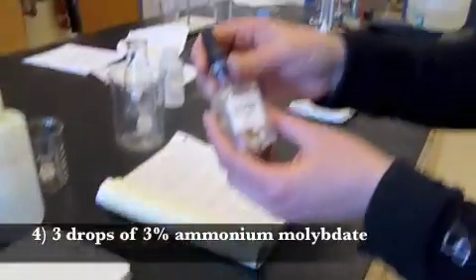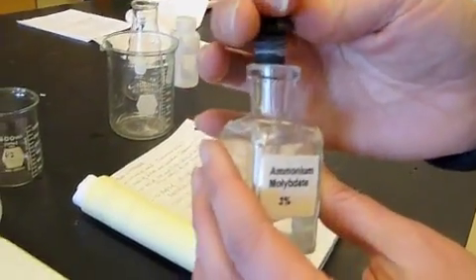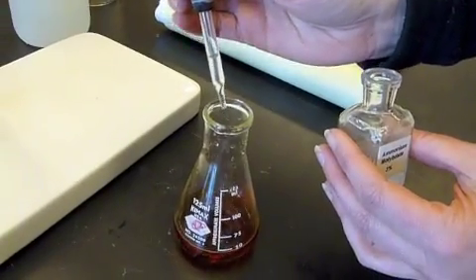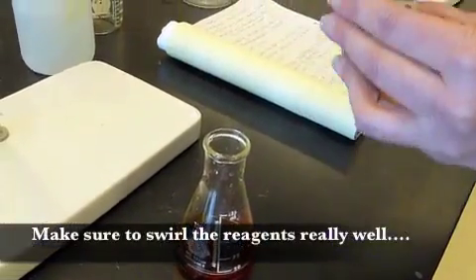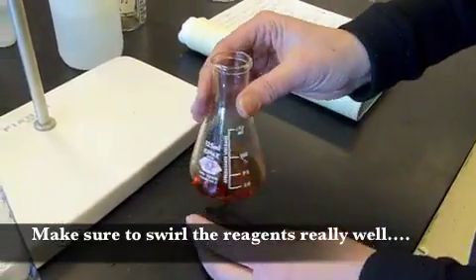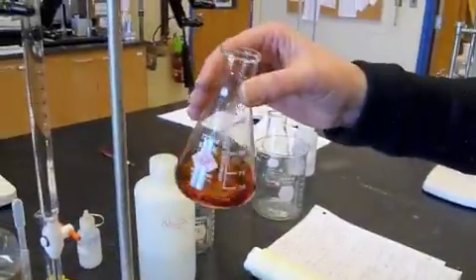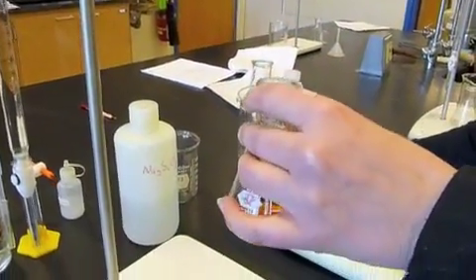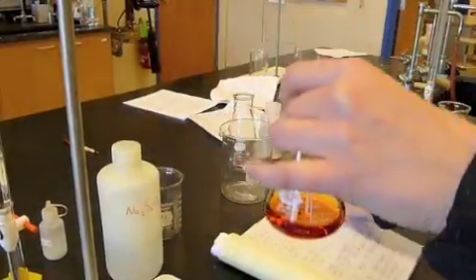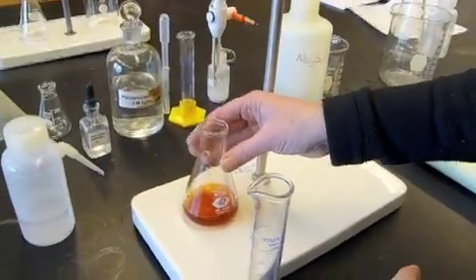Three drops of the ammonium molybdate, 3%. This is a catalyst. Immediately, I'm going to go ahead and titrate that. All right, ready? Go ahead and release that.